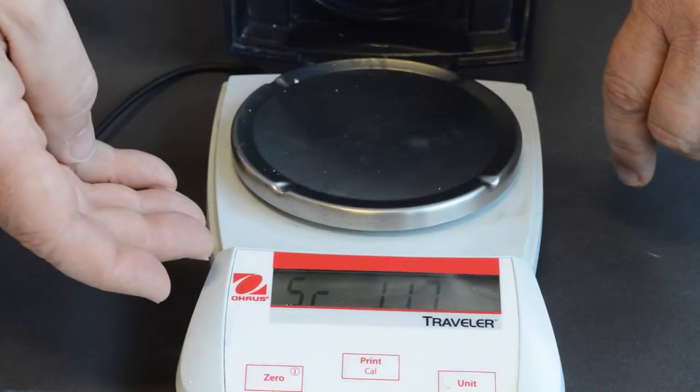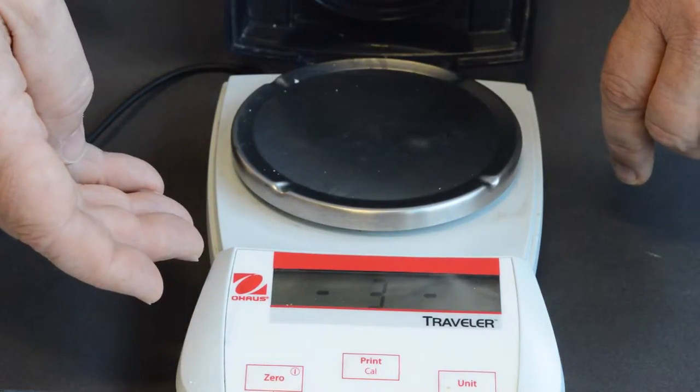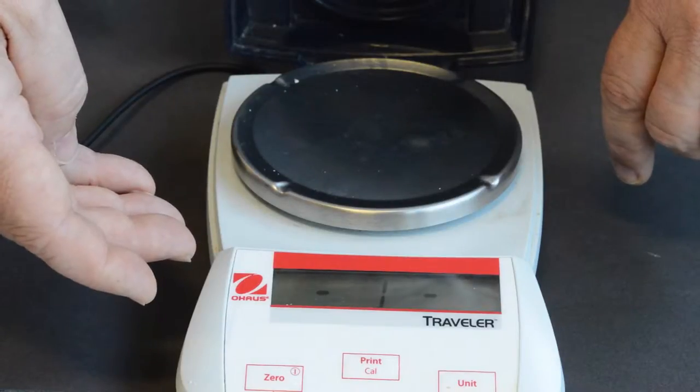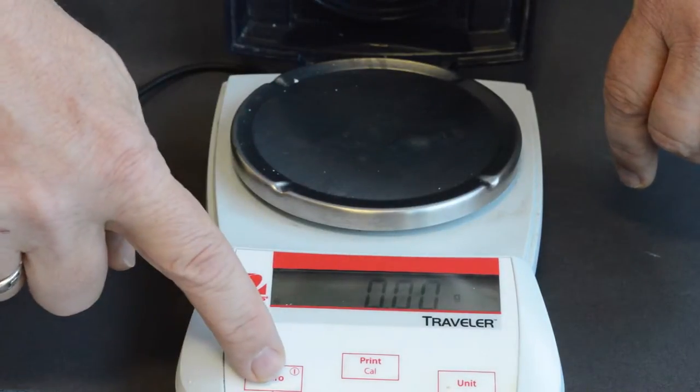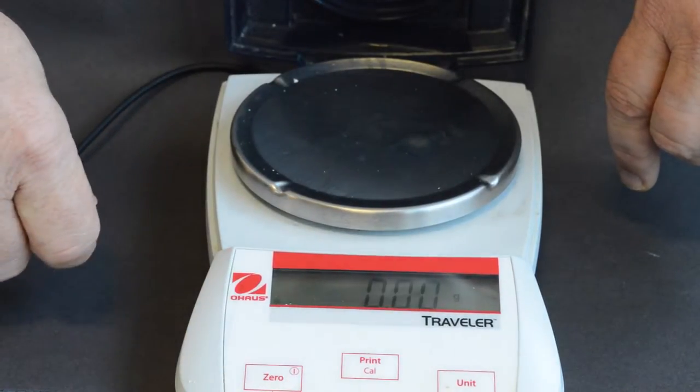Wait for the counter to arrive on screen and wait for the counter to reach zero. If the balance is already zeroed, leave it as is. If it doesn't read zero, press the zeroing button.